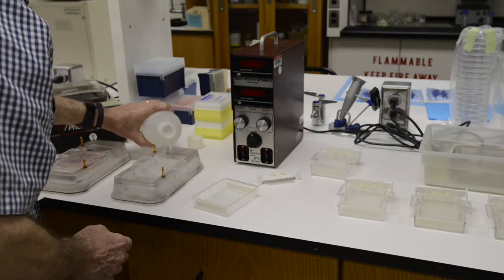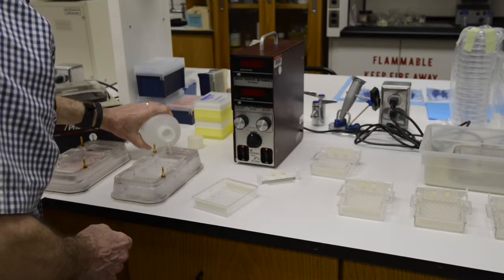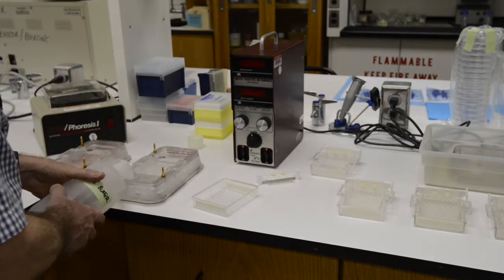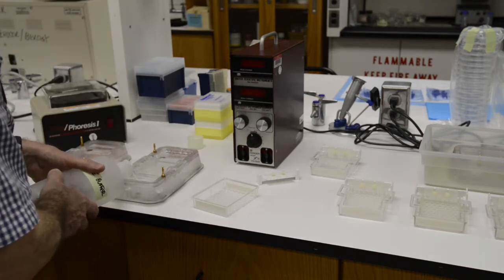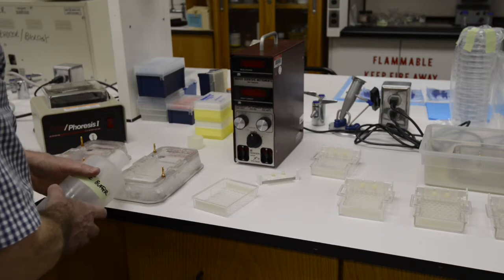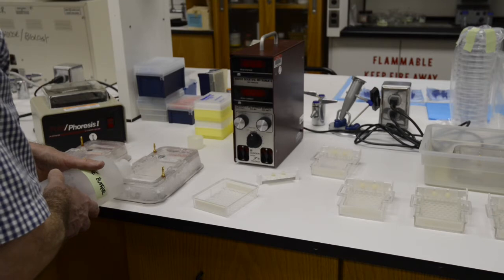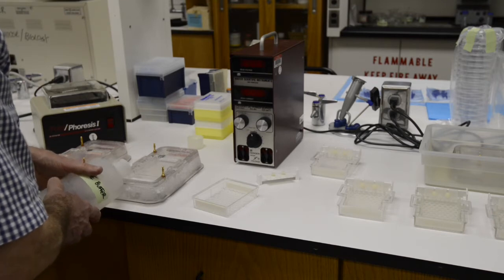Then you're going to take TAE buffer. It's just a salt solution that will conduct a current and pour that into the wells at the ends of the running tray. You want to put in enough so that you just cover the gel and you fill the wells of the gel with that buffer.